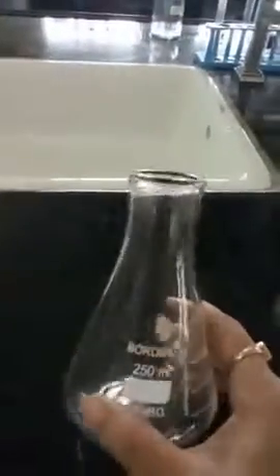And this is called as titration flask, in which we are doing the titration. As you can see it has quite a cone-like structure, so this is also called as conical flask. So these were all of the apparatus which are used for titration. I hope this much is clear to everybody.